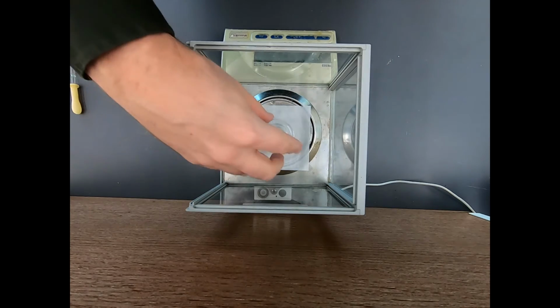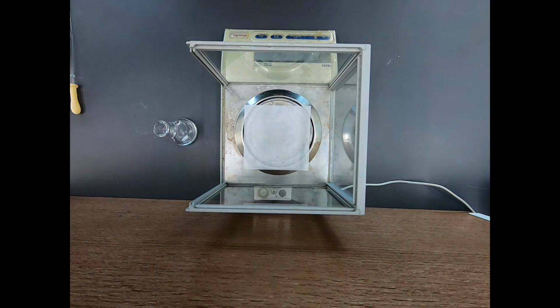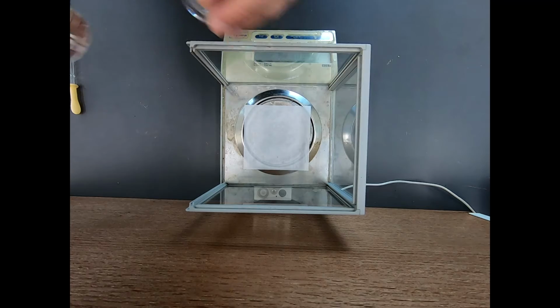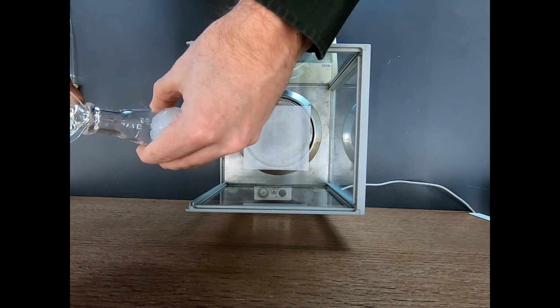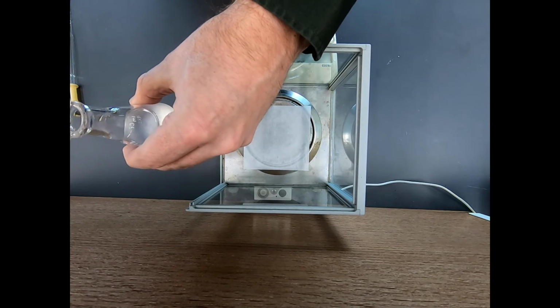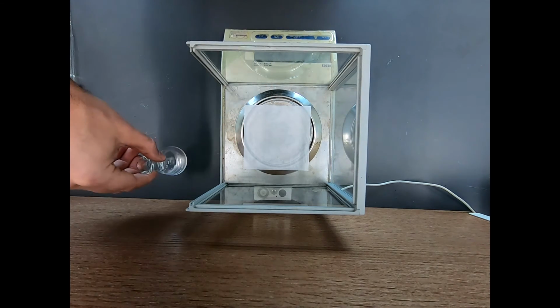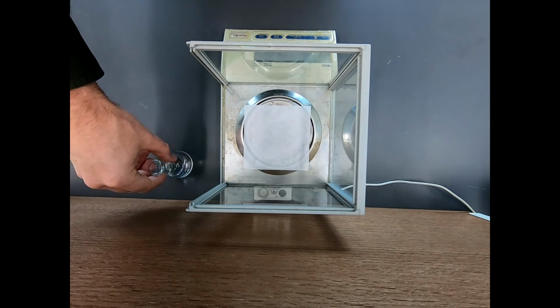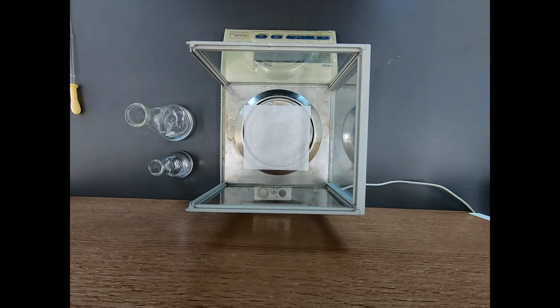Now, this is now a mixture of acetone and benzaldehyde. I'm going to go ahead and add in a mixture of ethanol and water. I'm not going to do it over the balance because that would be risky. 30 milliliters of ethanol and water, and everything is slowly dissolving. Now at least we have both of our reagents, our benzaldehyde and acetone, and our KOH is well on its way of being dissolved. Now we'll take both of these over to the hood, and we will start our reaction.